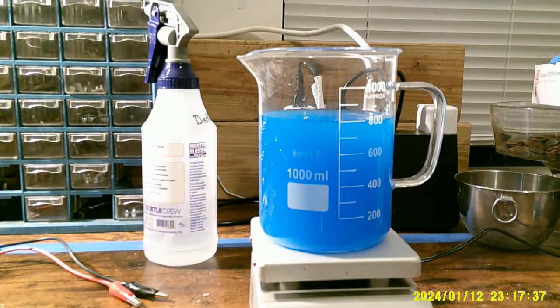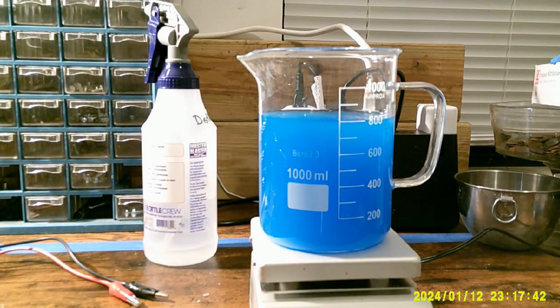Give me a few more videos and I'll actually be a competent amateur with this stuff. All right, that's got to spin for a couple of minutes. And once it's done spinning, I will stop the stirrer, take the stir stick out, and allow it to settle on down.